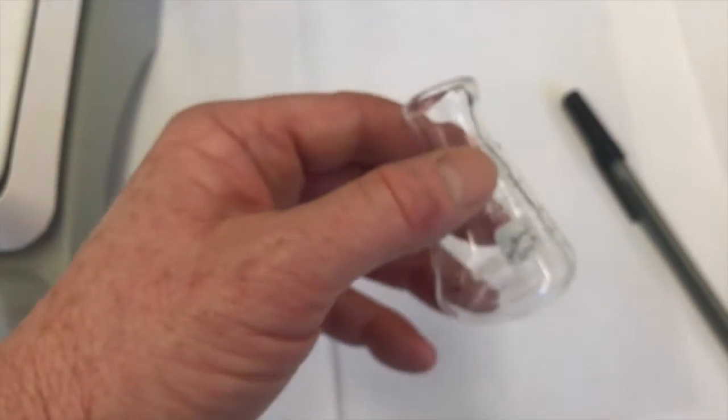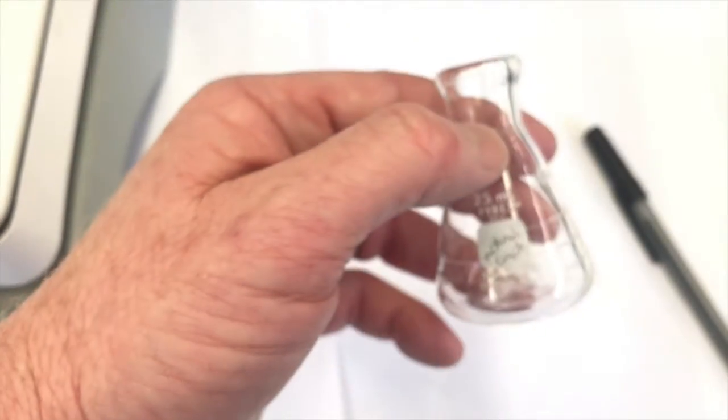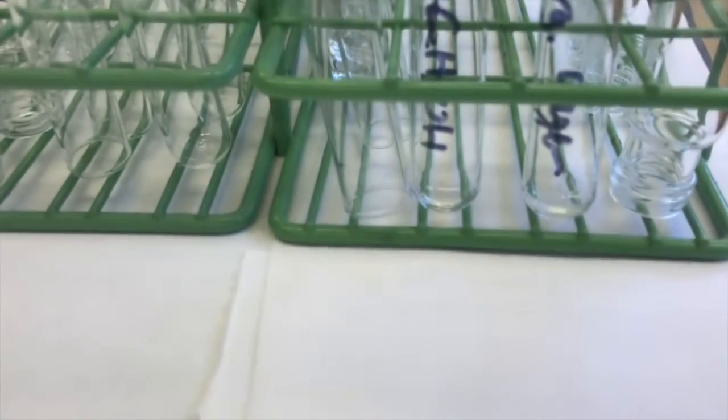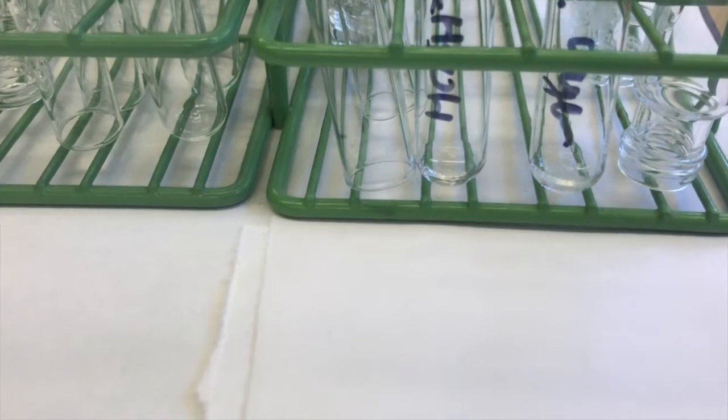It's hard to write on the small flasks, but I'll understand what that is. So I need to add my methanol to this. And let's check our tests so far. Has there been any crystallization yet? No, they're still cooling. That's okay, we'll get to those shortly.